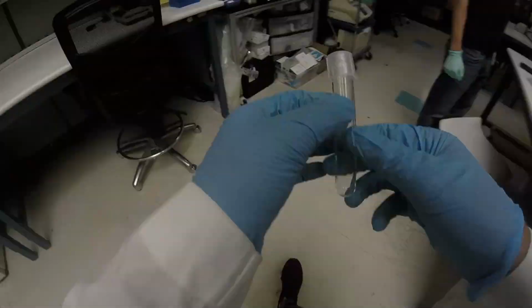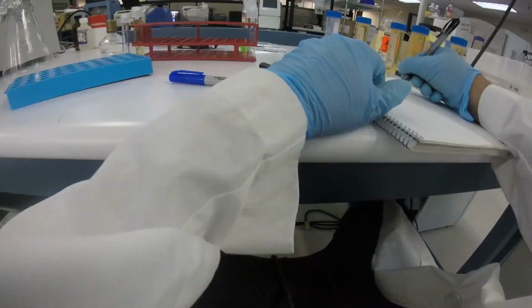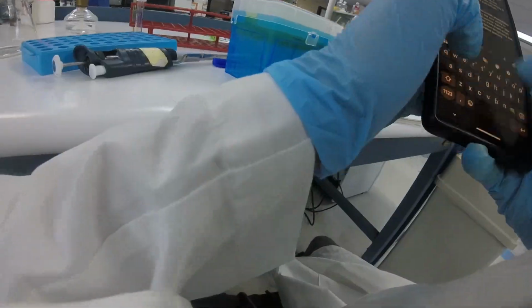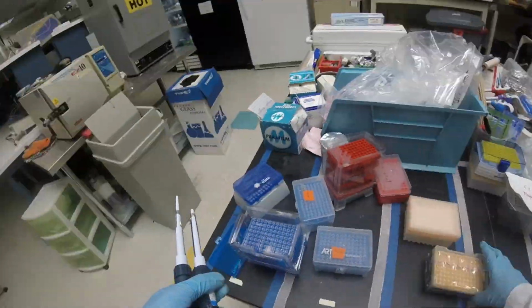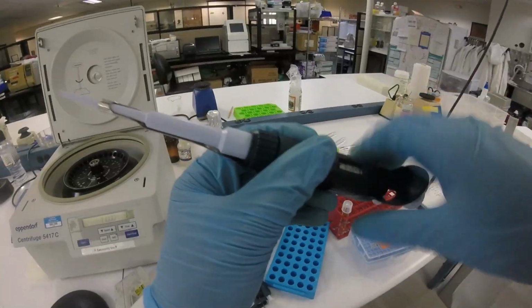All right, so most of the rest of this footage is just sampling, doing the same thing over and over again. However, towards the end, one thing that's really cool is I joined in on this project to make real vegan cheese. I don't really know anything about cheese, and I don't really know about this project. But from what I gather, the goal is to produce a couple of the main proteins that are in cheese in yeast. And the really interesting thing here is that yeast is eukaryotic.